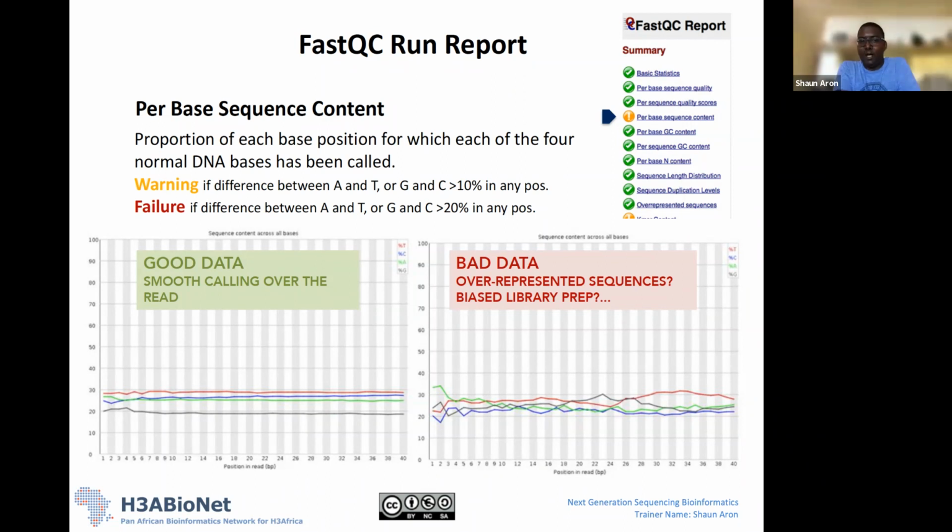And what we're expecting here is that across all our reads, we should see a relatively consistent percentage of A's, C's, T's, and G's, for a particular position. Okay, and that's what we're seeing here. We're seeing a relatively consistent percentage of T's, a relatively consistent percentage of A's, C's and G's as well. So we're seeing this almost straight line going across our bases.